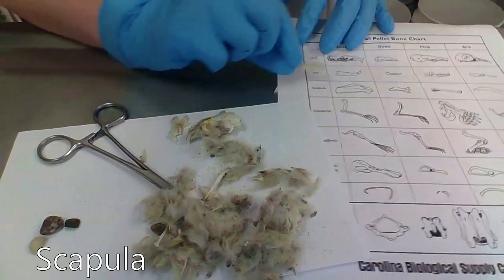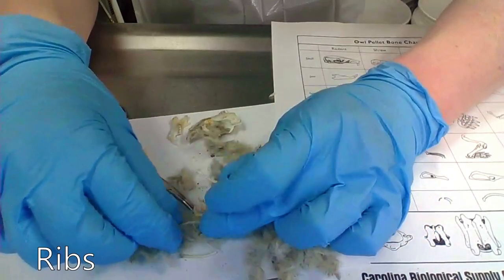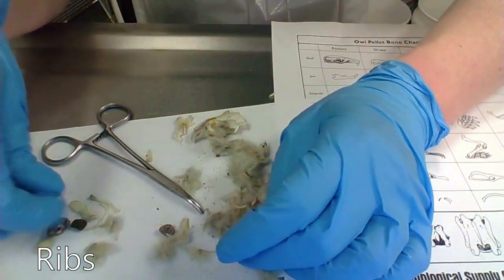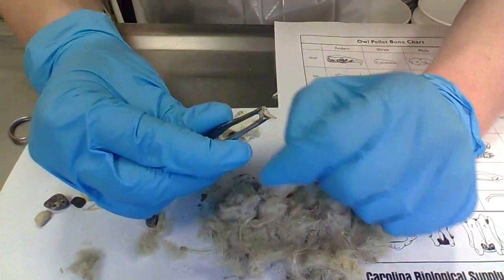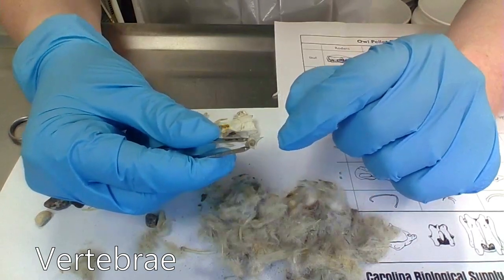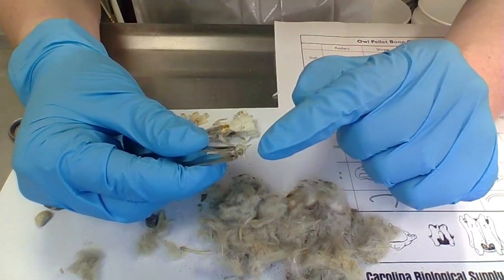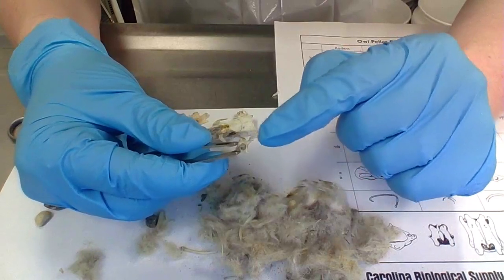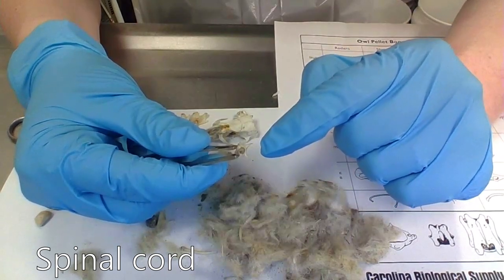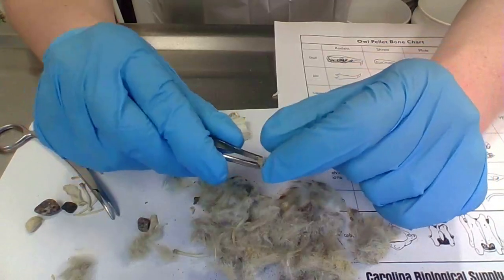If we look at our handy dandy guide, I think that's the scapula. Lots of ribs — I can see a bunch of different ribs. So this is a vertebra. If you feel the back of your neck down your spine, you'll feel all those little bumps — those are the bones of your spine, your vertebrae. This hole in the middle here is what those vertebrae are really protecting: that's your spinal cord, all the electrical wiring of your body connecting your brain to the rest of your body. You have different shapes of vertebra for different parts of your body.